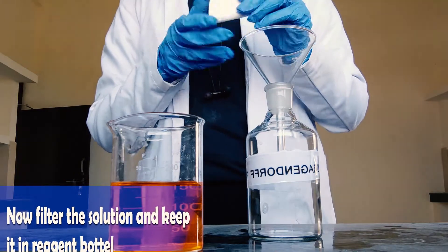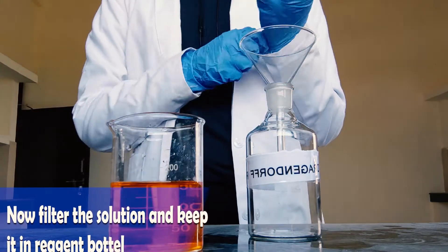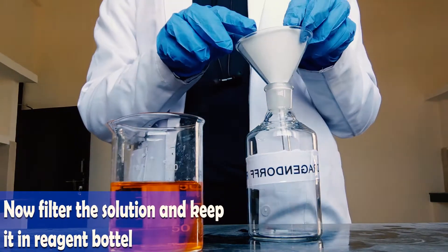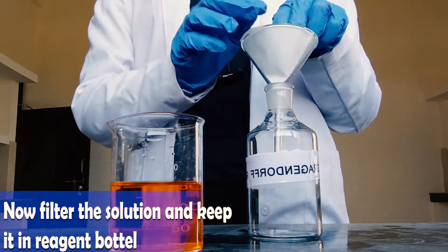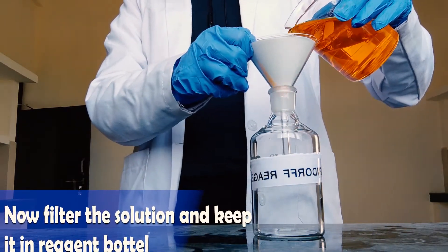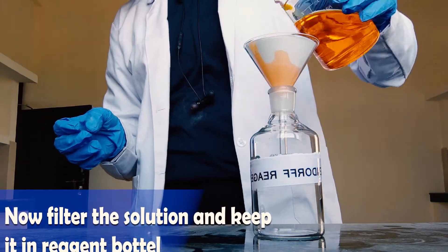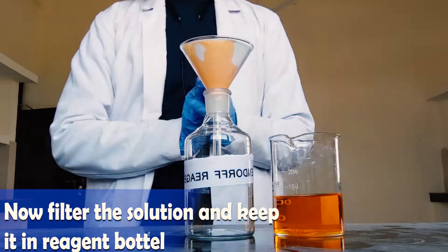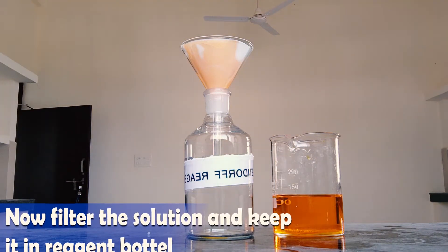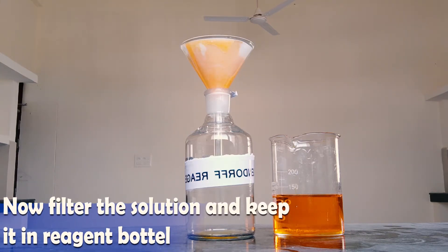Now Dragendorff reagent is ready. Keep it in a reagent bottle — take the reagent bottle and label it as Dragendorff reagent. Place a funnel with filter paper on it. Always filter the reagents so that you get the purest form of the solution. Properly place the filter paper and start filtering. This will take a bit of time, so be patient. After filtration, close the reagent bottle and keep it aside.